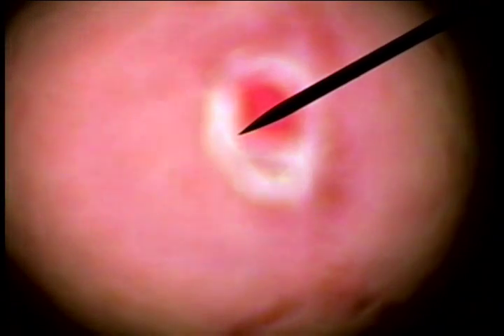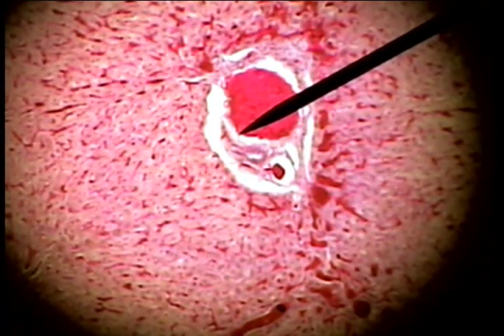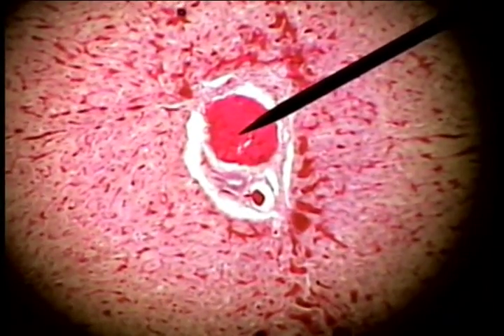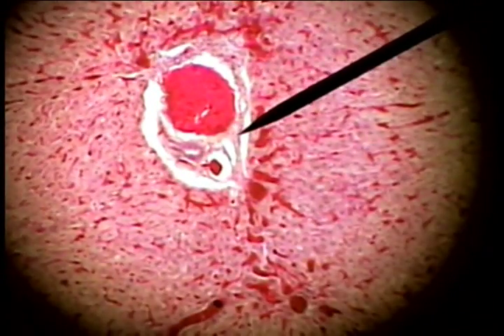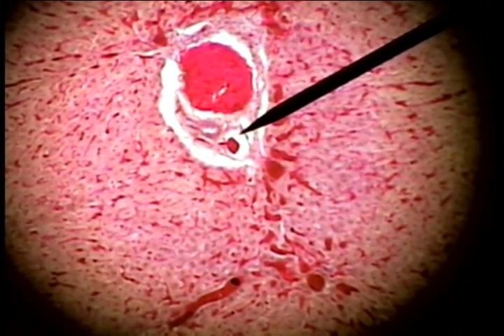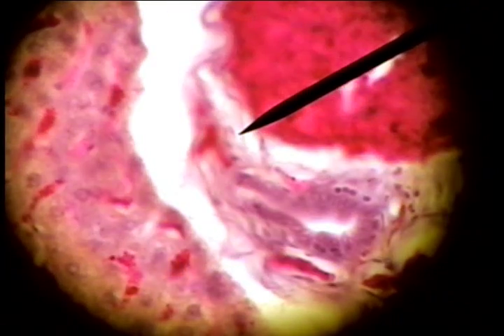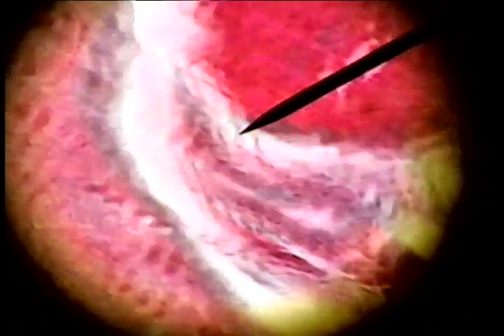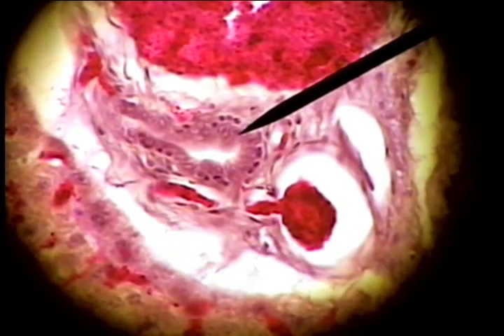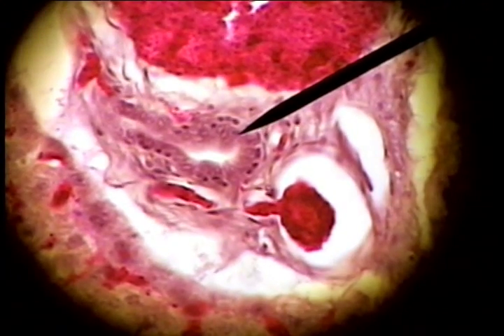If we go down onto high power and look at this again, the large portal vein, the next is the hepatic artery, and then the bile duct. The way that we can tell the difference is that the bile duct is made up of cuboidal to columnar epithelium.